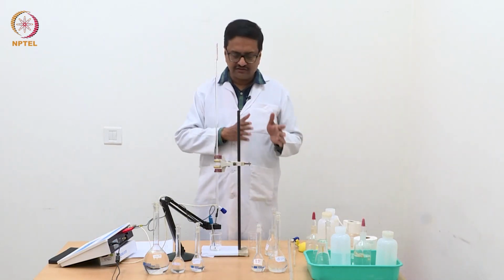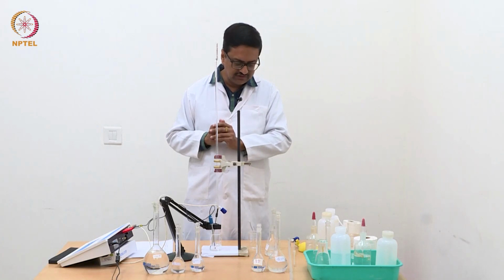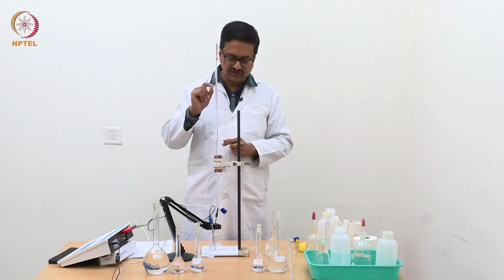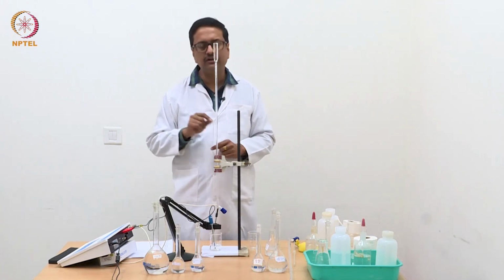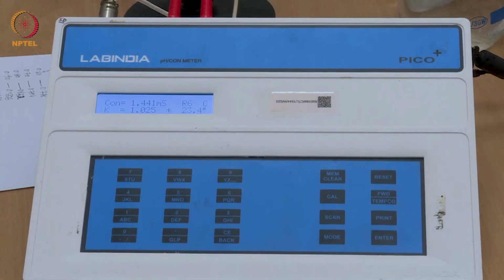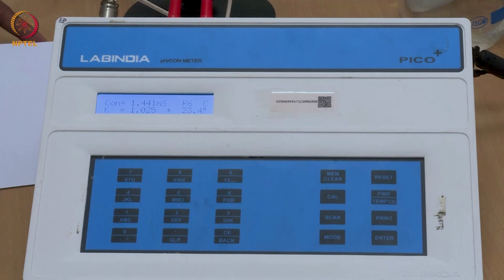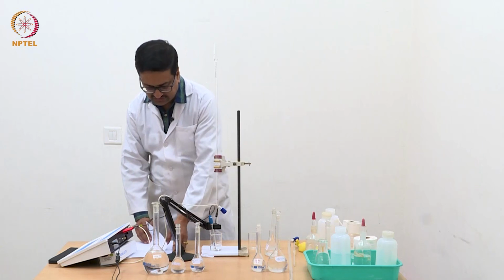This experiment has two parts. One part is the NaOH titration, the other part is the silver nitrate titration. The method of titration is the same: you keep adding the solution gradually from the burette, note down the values of conductance continuously, and then plot them. Now, as you can see on your screen, we have a solution of 0.01 molar HCl, and the conductance reading here is 1.441 millisiemens with a cell constant of 1.025. We will require the value of the cell constant in the calculation.